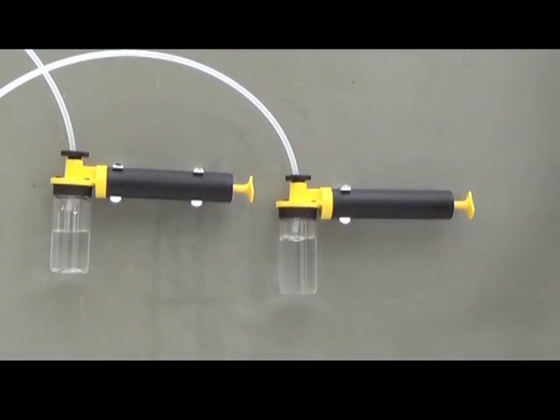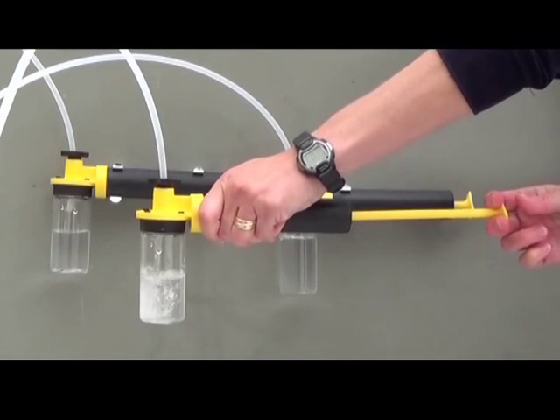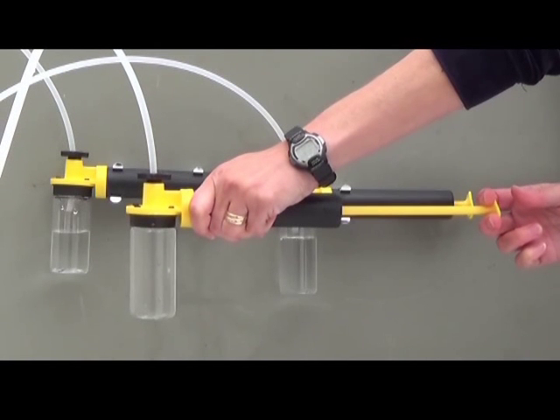Watch how two strokes will fill to a certain level in the bottle, whereas three strokes results in a higher level. If you hold the piston out, you will more than likely overfill the bottle.